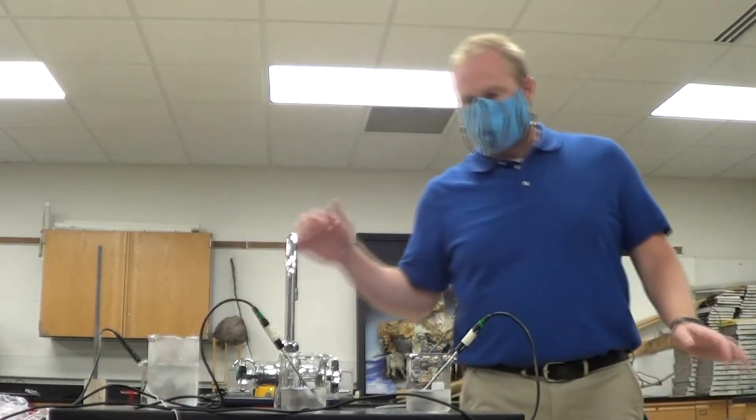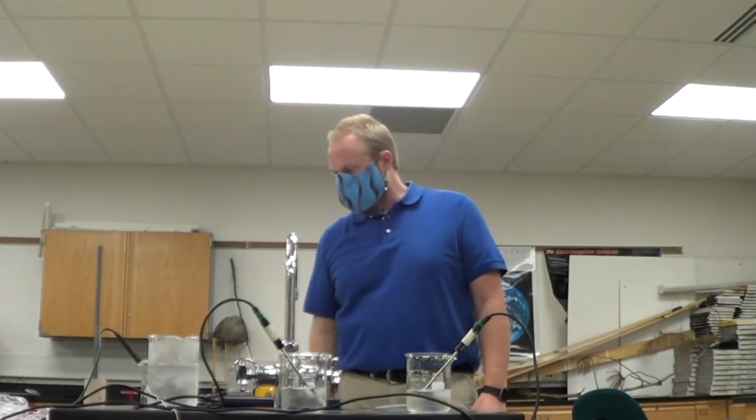Okay, so they're getting closer, right? They're close. We're within 0.4 degrees. Now that could just be the calibration of these. So we're going to say that they're pretty darn close. So we're going to say that my 2 cold beakers are the same.